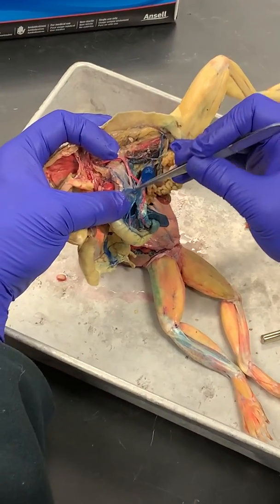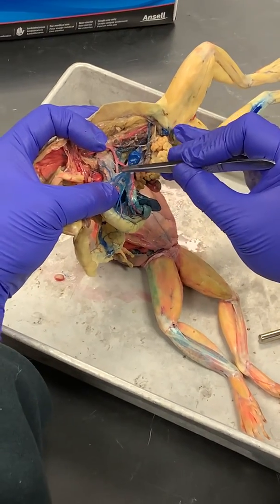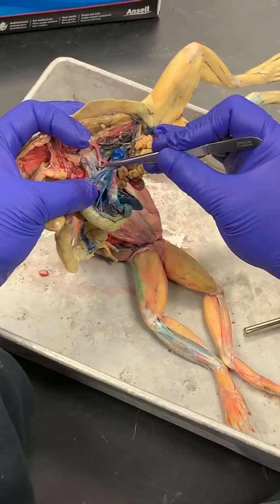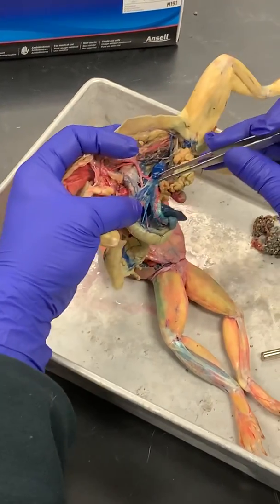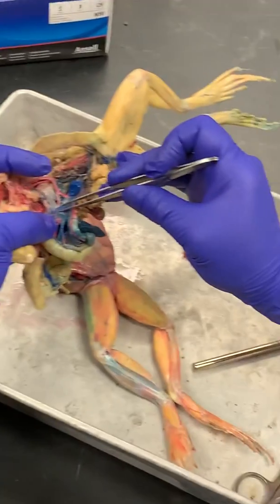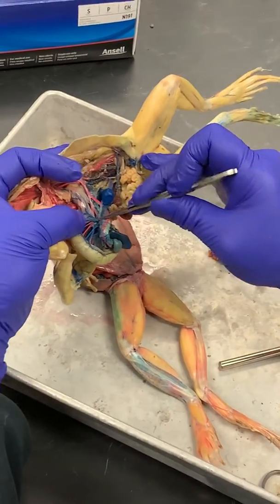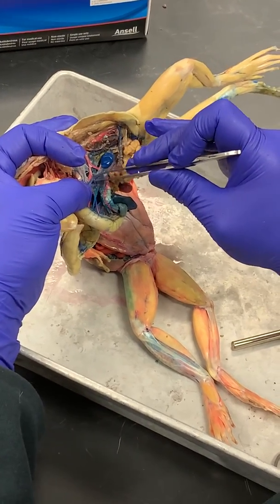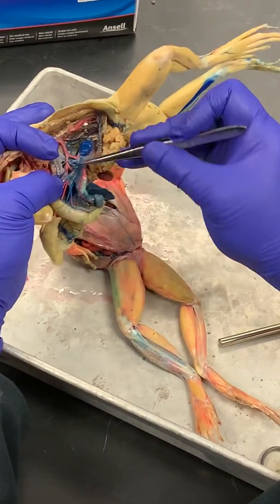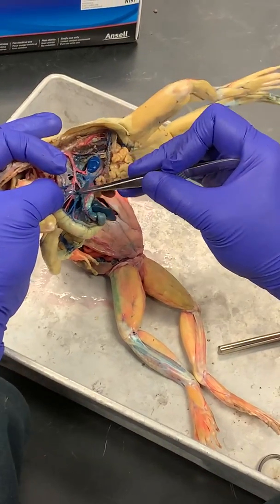Right? And the celiaco-mesenteric trunk, look, it has two major divisions. There's one that goes anteriorly. This is the celiac trunk artery. Okay, and I'm going to peel away the greater omentum here so that I can identify the two main branches of the celiac trunk artery. It looks like there's three here, but we'll pretend there's two.